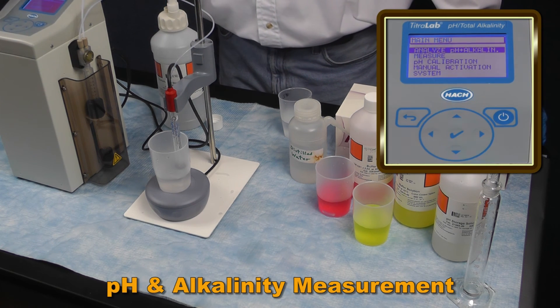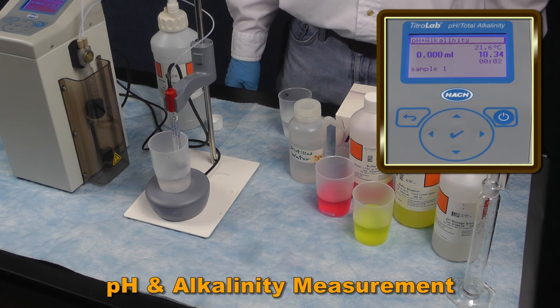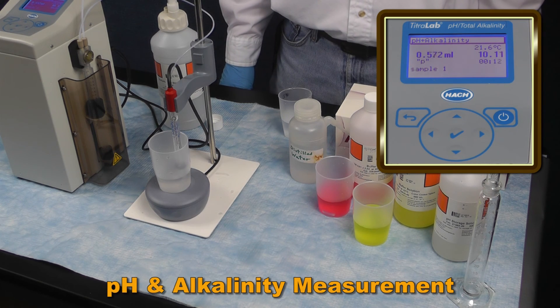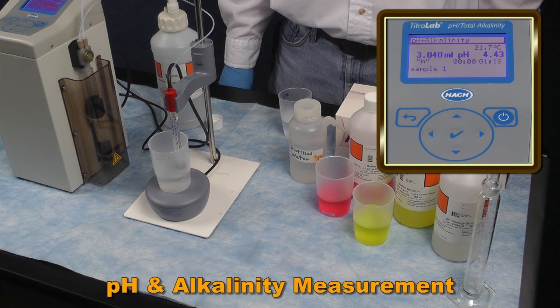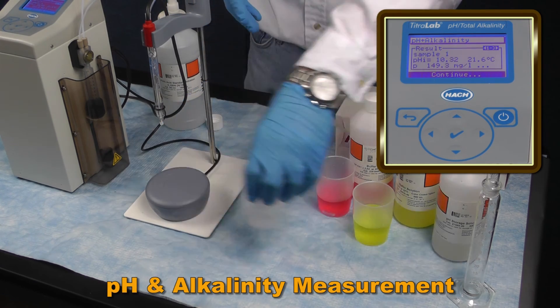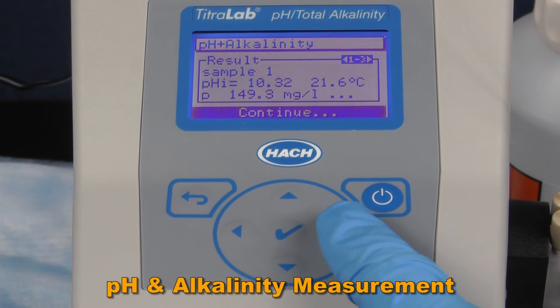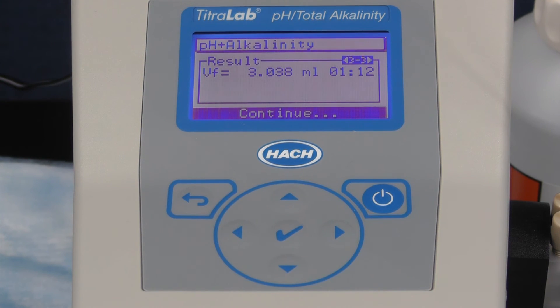On the main screen, select Analyze pH and Alkalinity and then press the check mark to start the analysis. A pH measurement is taken first, followed by the titration. After the analysis is complete, the results will be displayed. You can then scroll through the results using the right and left arrow keys.